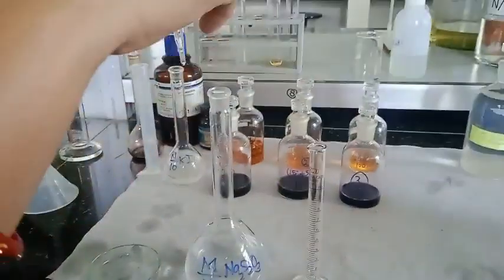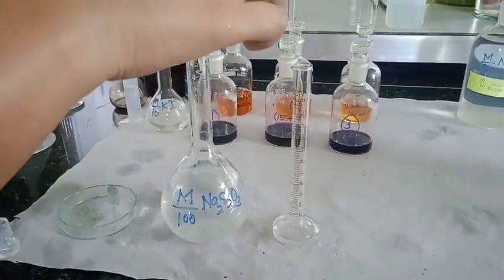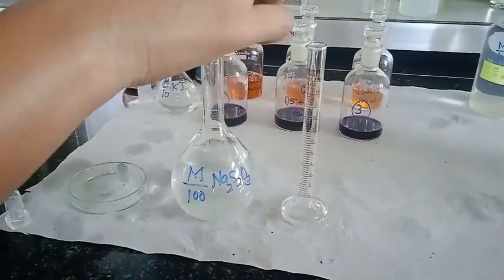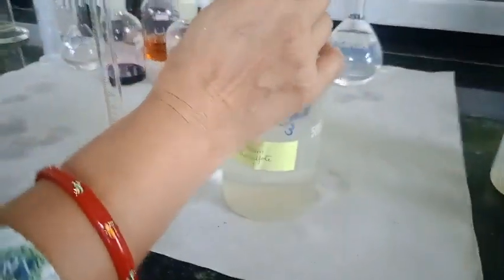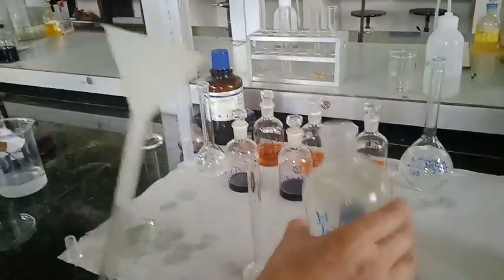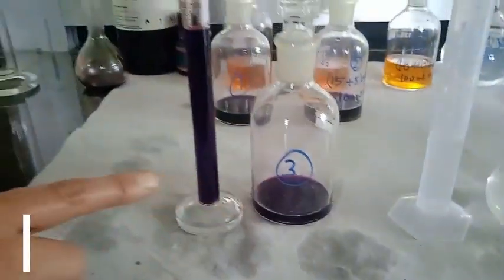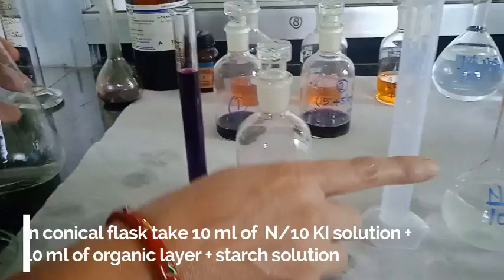Now we are just going to transfer this M/100 sodium thiosulfate solution from the burette to the measuring flask. And now we are going to rinse our burette with M/10 sodium thiosulfate solution, and after rinsing, fill it with M/10 sodium thiosulfate solution for titrating the organic layer. So for that purpose, I am taking 10 ml of organic layer with 10 ml of KI solution. So here I am just going to transfer 10 ml of KI solution.